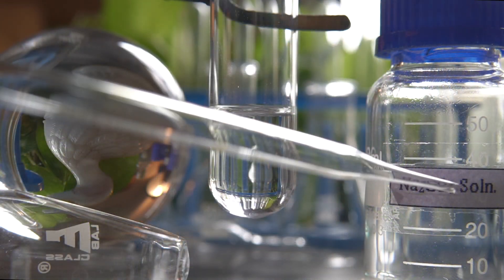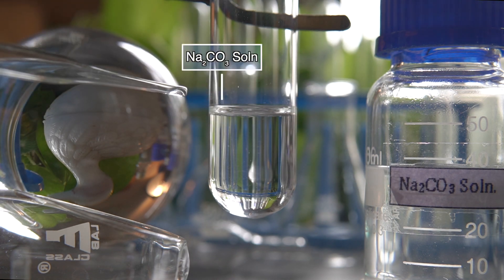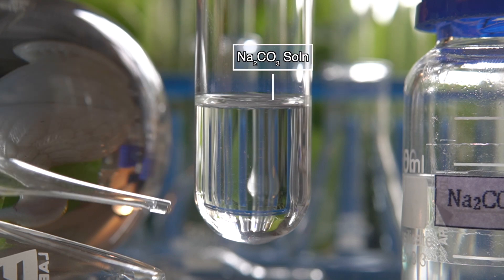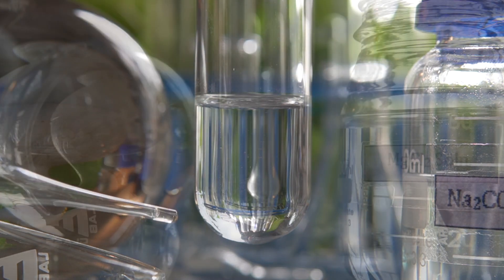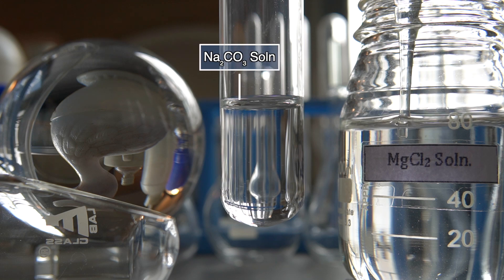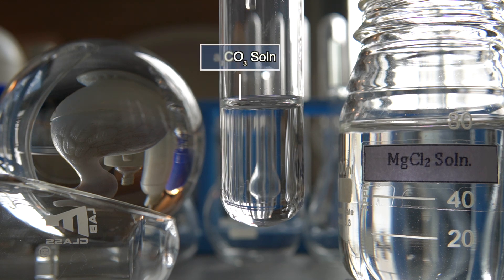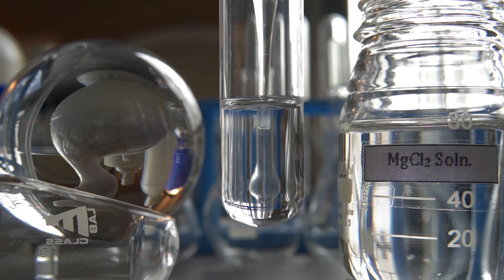Now to initiate the chemical reaction, we will take some amount of sodium carbonate solution inside this test tube. Now we will add magnesium chloride solution slowly into the sodium carbonate solution and observe the effects.